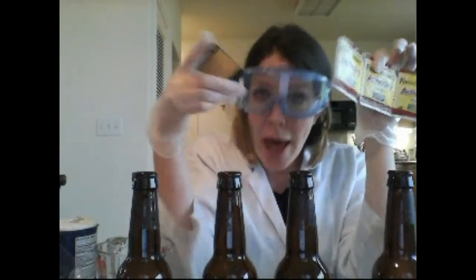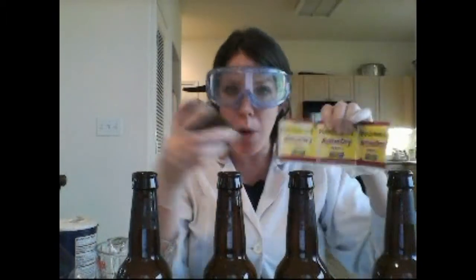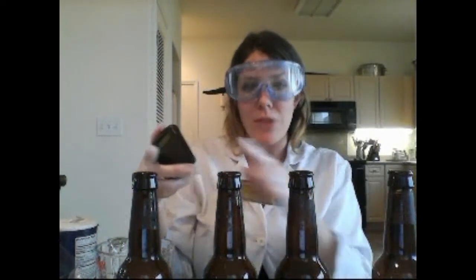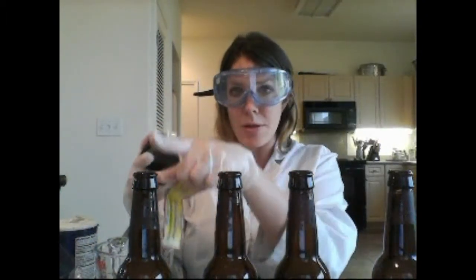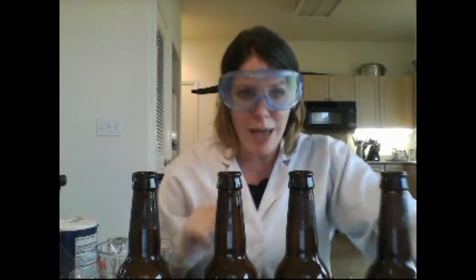Go ahead and use all three packets if needed, but weigh out three sets of seven grams of yeast and one set goes into each bottle. By the end of that step, every bottle should have seven grams of yeast.